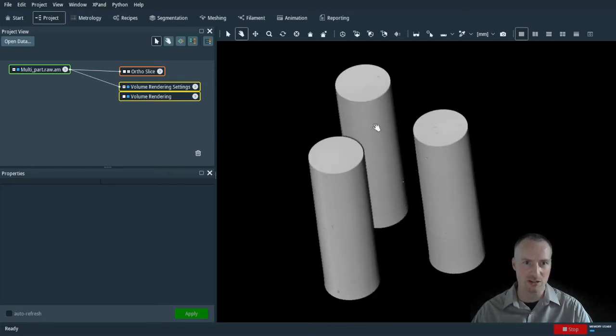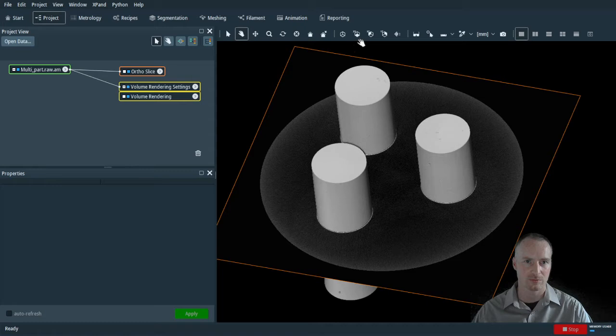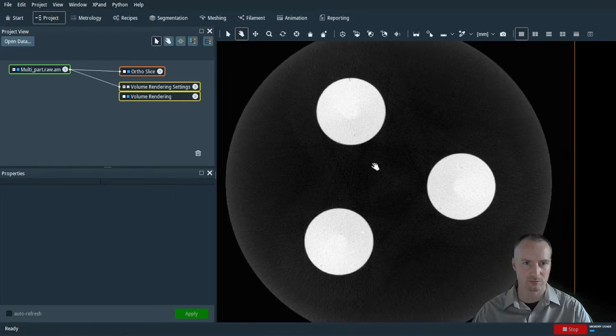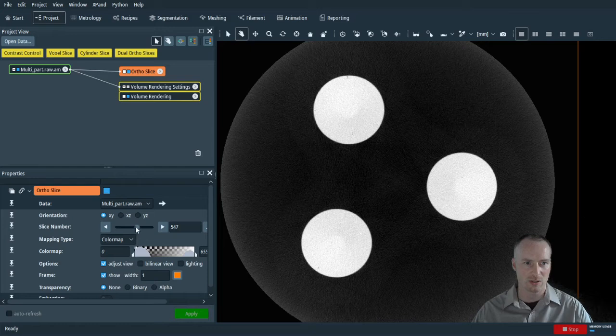However, to ensure this is correct, the easiest method is to look at the ortho slices. I will be looking at the ortho slice along the XY orientation. On the ortho slice, we simply move through the image stack, checking for any artifacts.